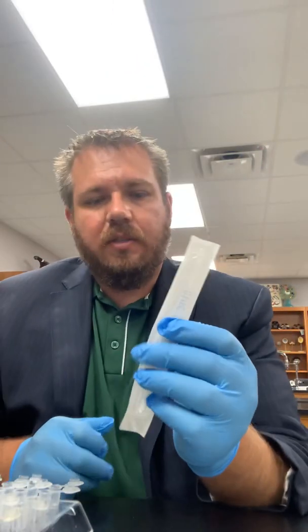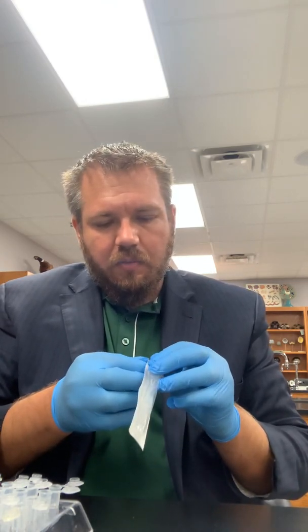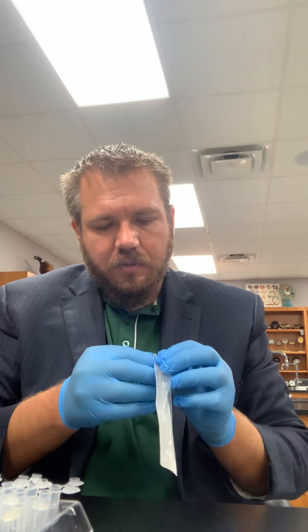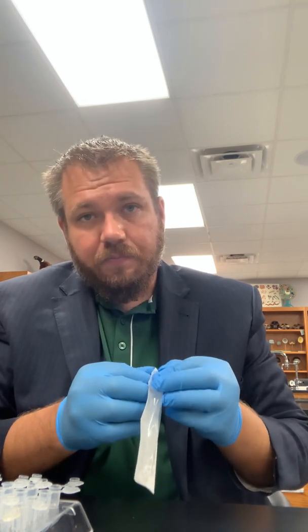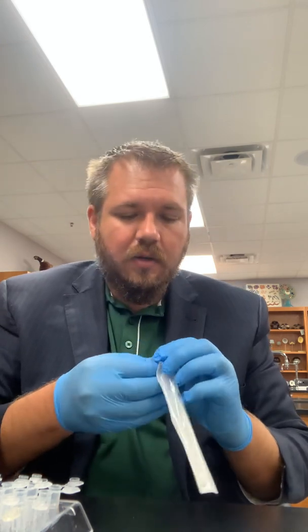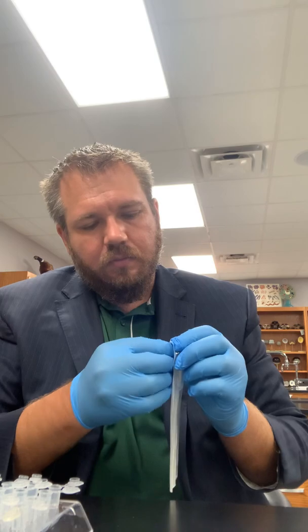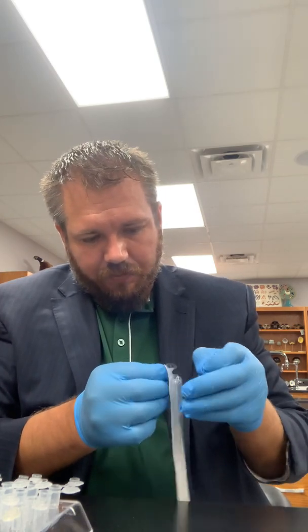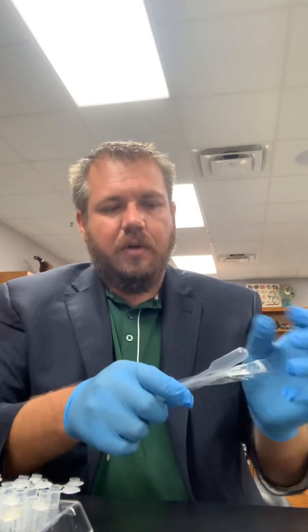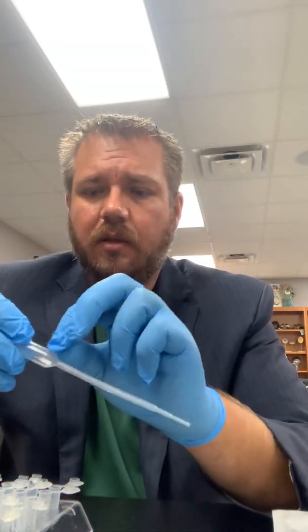So your transfer pipettes, you want to open them up, and it's a good idea to label them. So we'll have some Sharpies available. This is one of the hardest parts here, is getting the packaging opening with gloves on. There we go. You just got to pull it apart up at the top, open it up, and you have a nice fresh transfer pipette. Now I like to go ahead and label them.